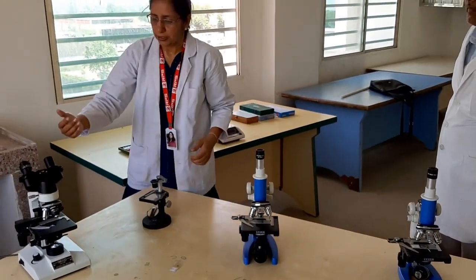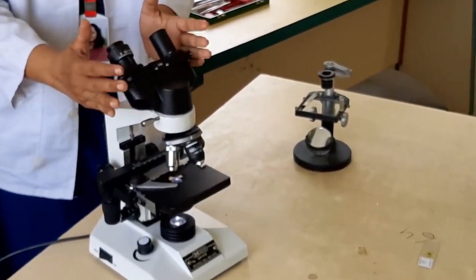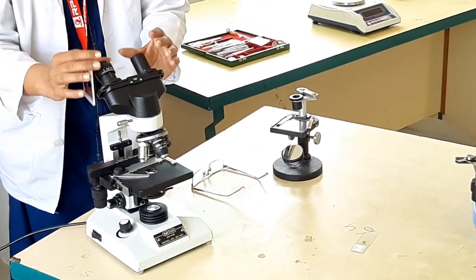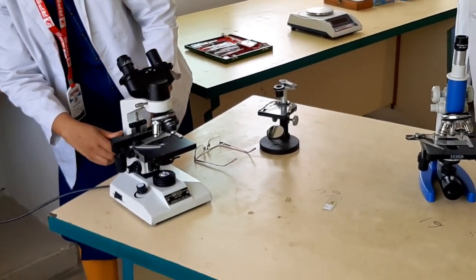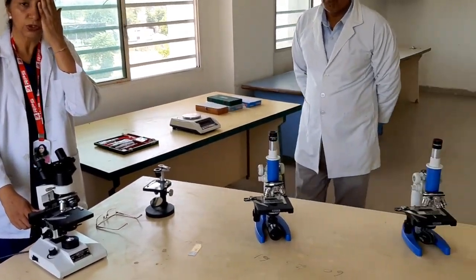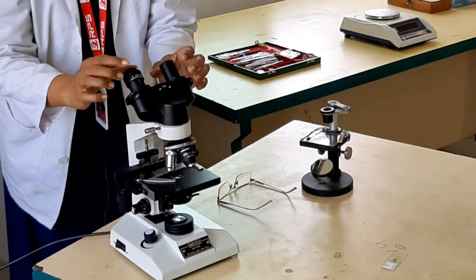The third type is also a light microscope, but it is called a binocular microscope. It is called binocular because we can see with both eyes. The advantage of the binocular microscope is that it puts less stress on our eyes. With a monocular microscope, you have to close one eye, but with this, you don't need to.